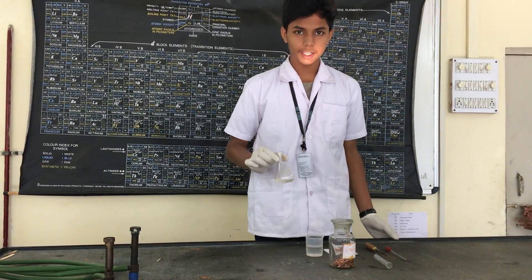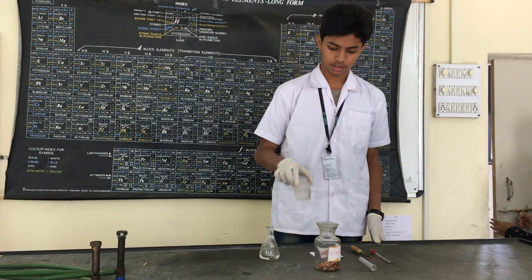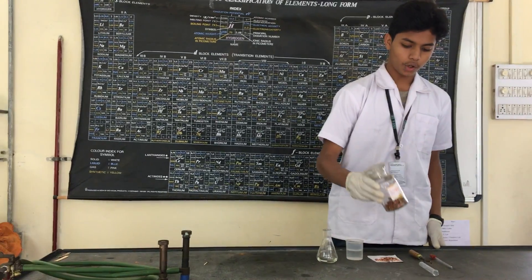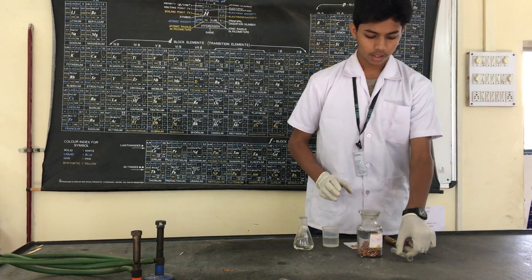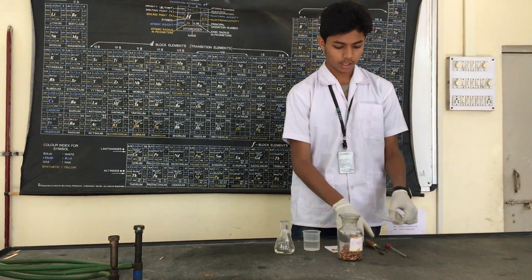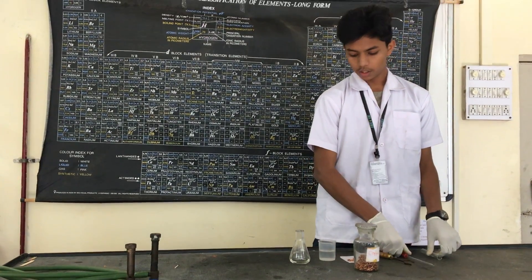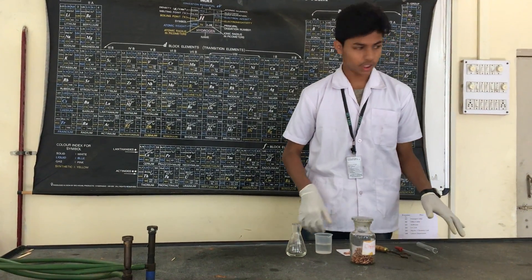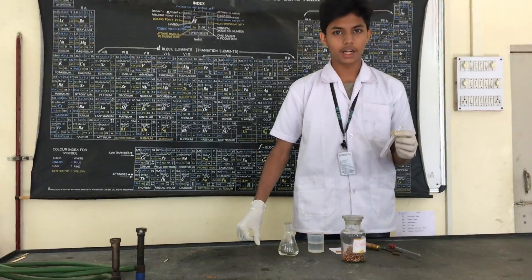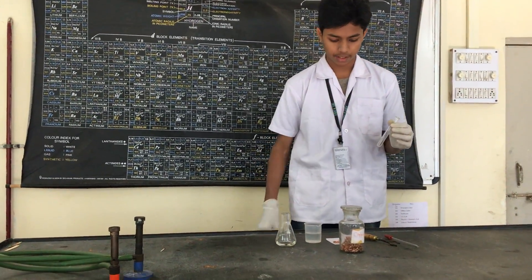So we have nitric acid, water, pure copper, a dry test tube, a test tube holder, and a dropper. The precaution we have to take is that the test tube should be completely dry and no amount of water should be present in it.